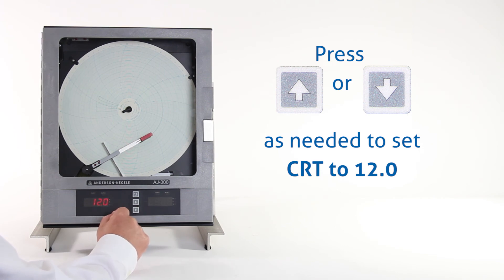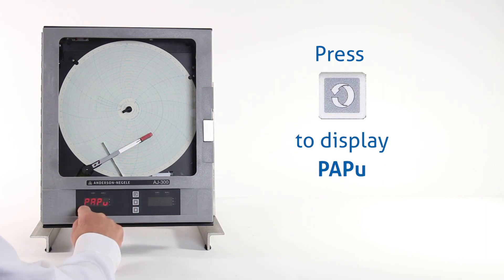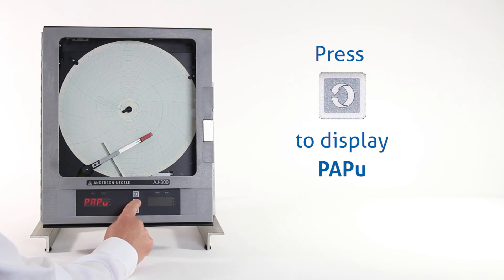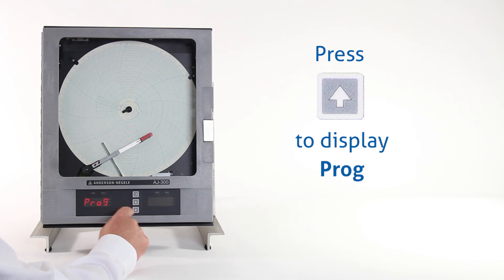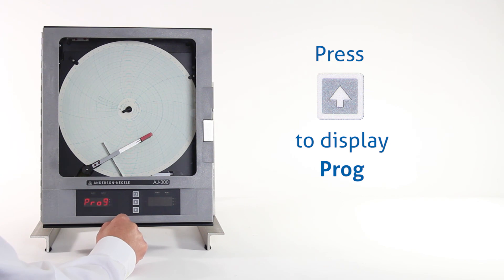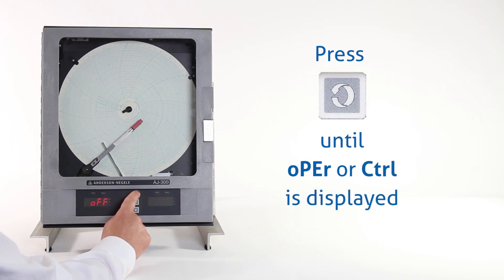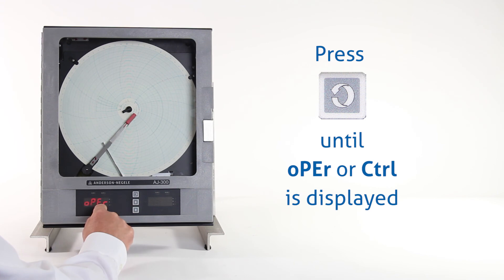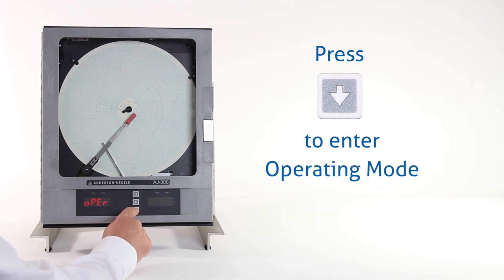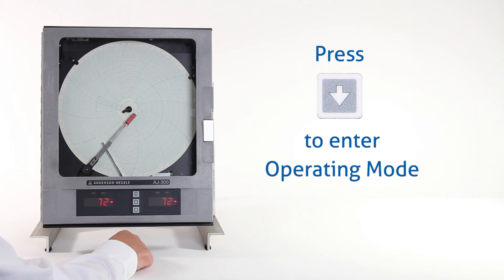Once we have that set at 12.0, we hit the scroll key one time. We'll see PAPU. Now to exit this menu, we hit the up arrow key. That brings us back to program on the display, but we want to go into operating mode. We're going to press the scroll key repeatedly until we see OPER. Once we have OPER, we hit the down arrow key, and that puts us into operating mode.